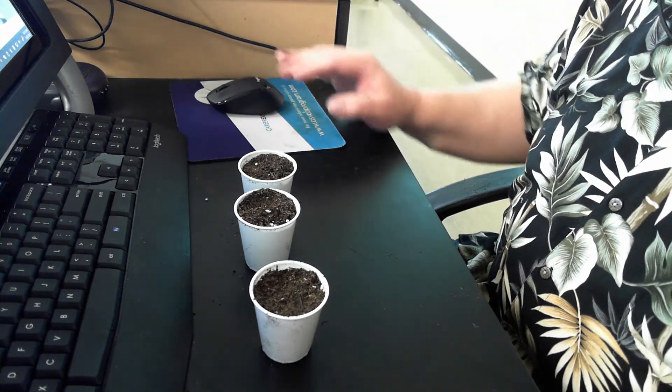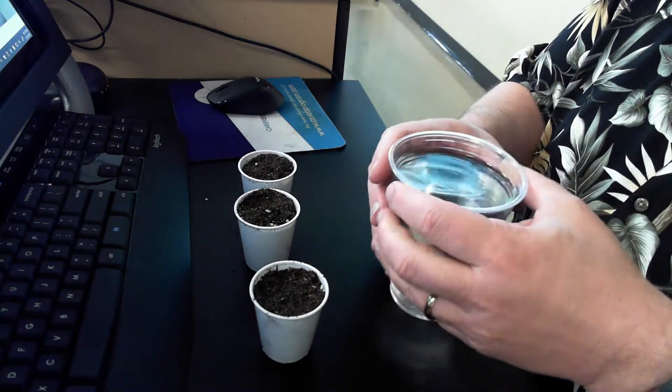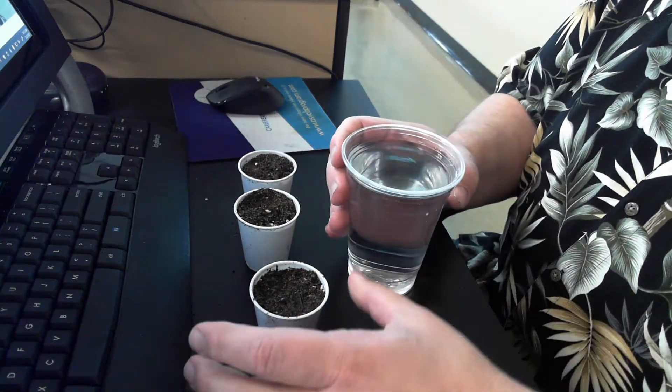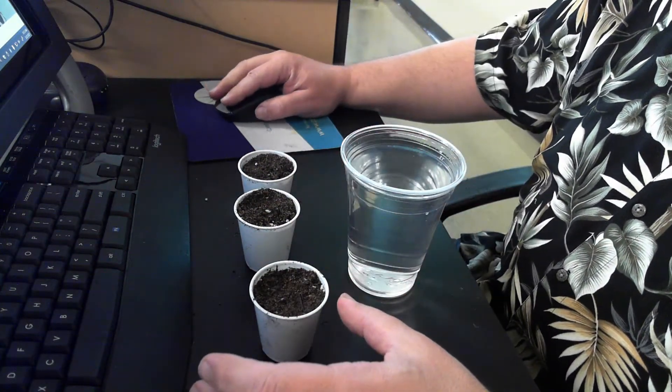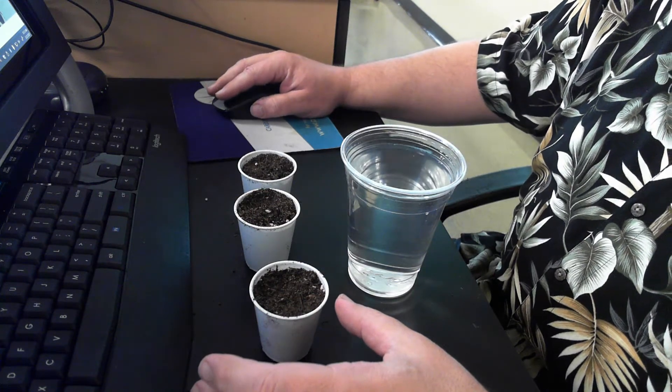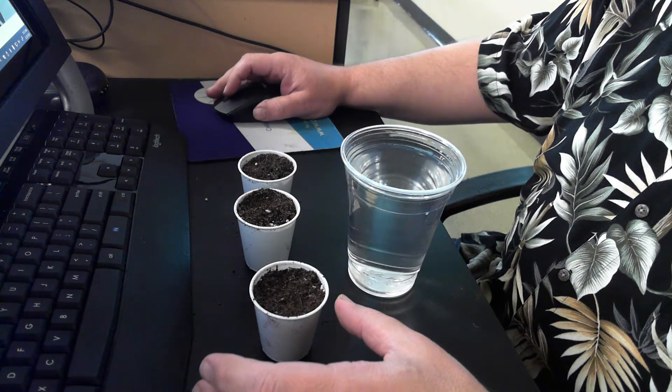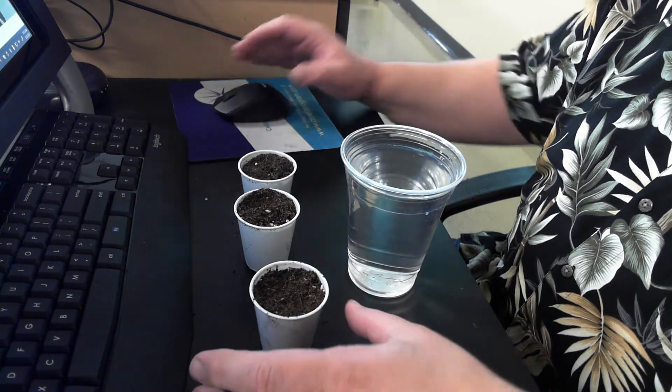Let me reach over here to the side. Grab my cup of water. I'm going to put a little bit of water in each one. I want the soil to be moist, but not soupy.